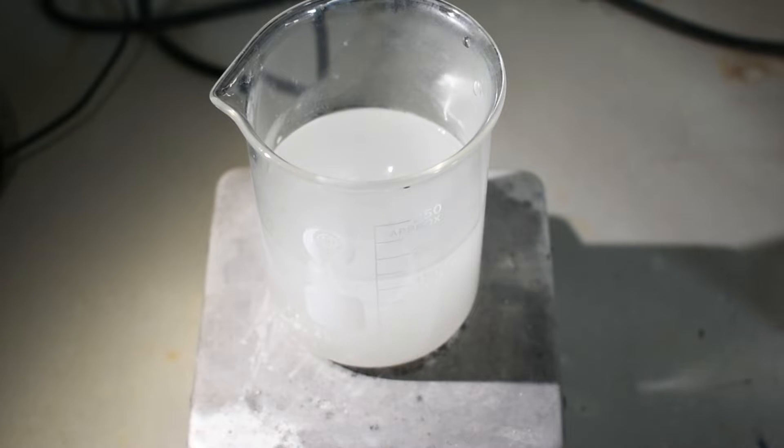I'm just going to probably either turn on the heat to medium on the hot plate, or pop it in the microwave for a little bit to get the solution warm enough so that everything is dissolved.